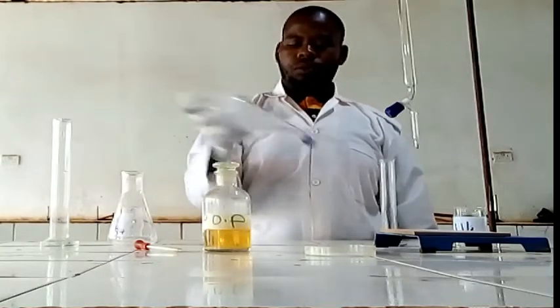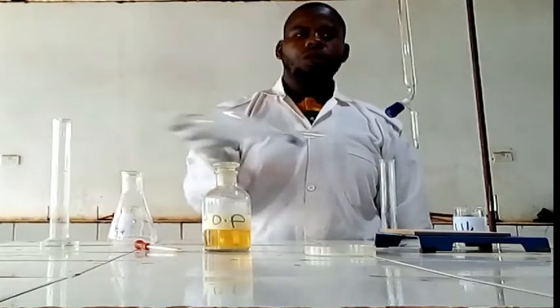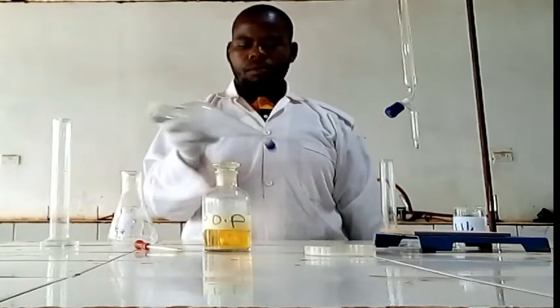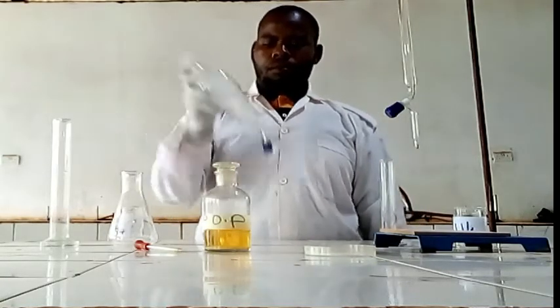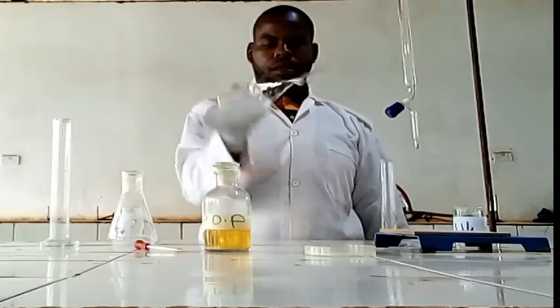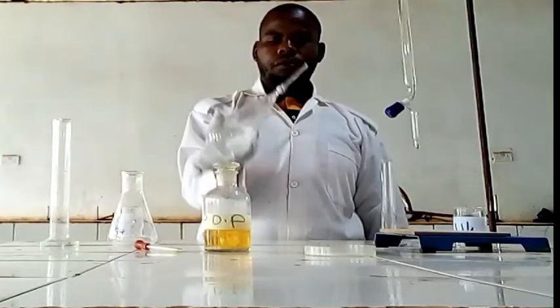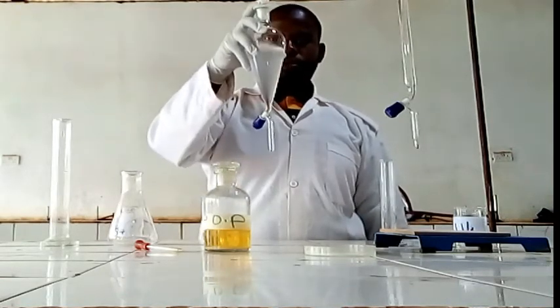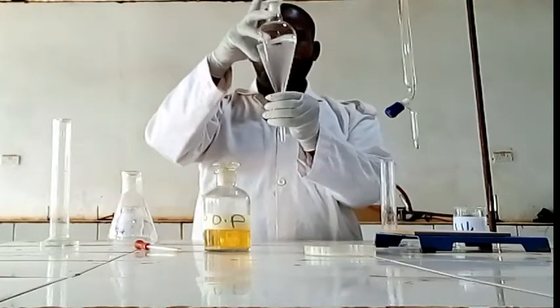We are going to shake. Make sure you shake well, in order to distribute your solution, then you leave it.